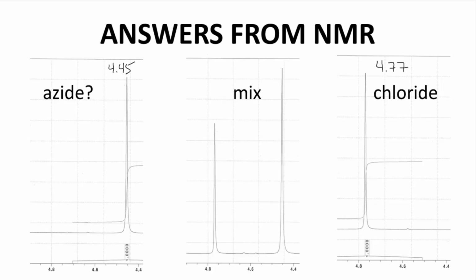This new spectrum in the middle shows the azide sample spiked with some of the chloride. Now we can see that the two peaks are definitely different. To be clear, this does not prove that the product is benzyl azide, but it is clear that the product is not the starting material, benzyl chloride.